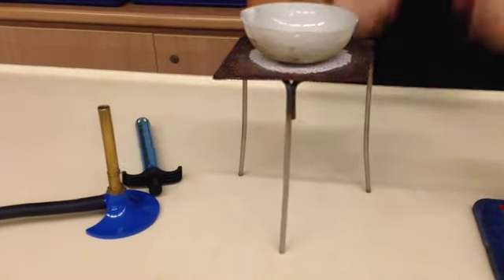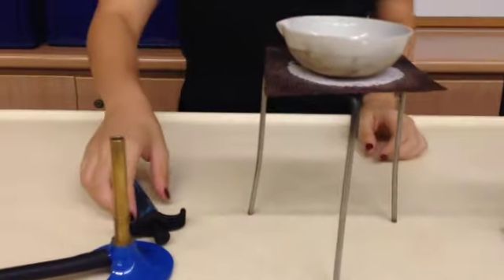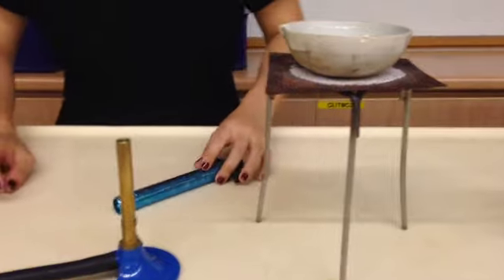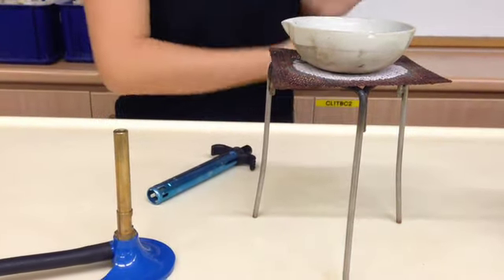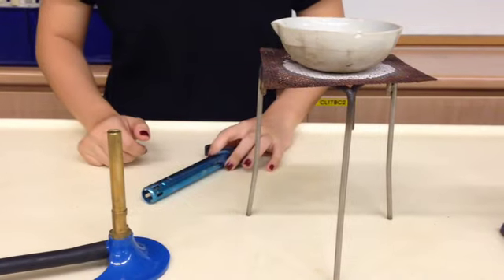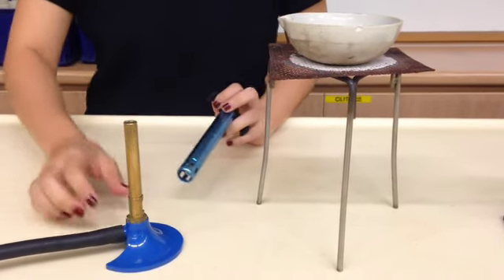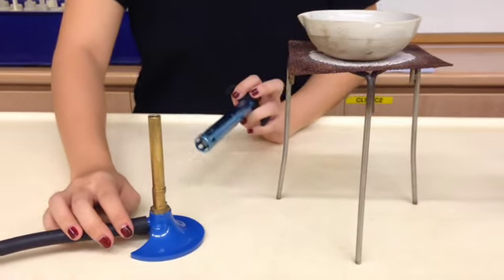Second of all, make sure that you are wearing goggles. Your safety goggles are extremely important because you are heating in this case. The next one is talking about the Bunsen burner. Some of you might already be quite familiar with the Bunsen burner from previous work, but let's just recap again for those who are not too sure.